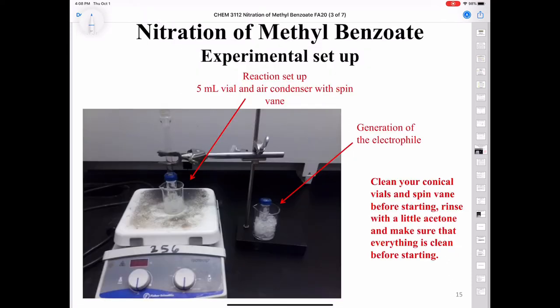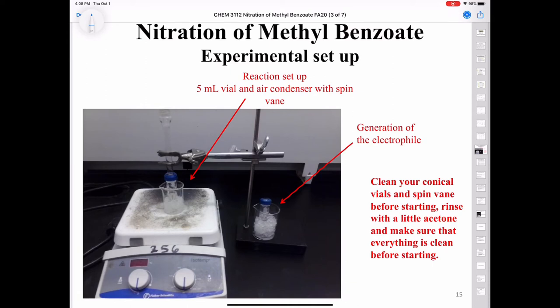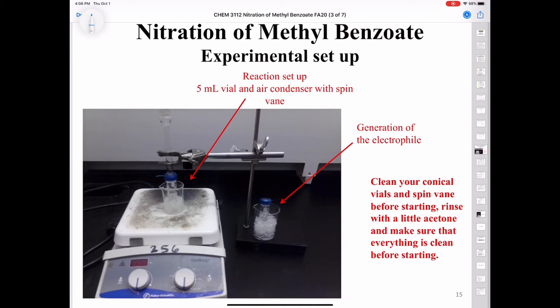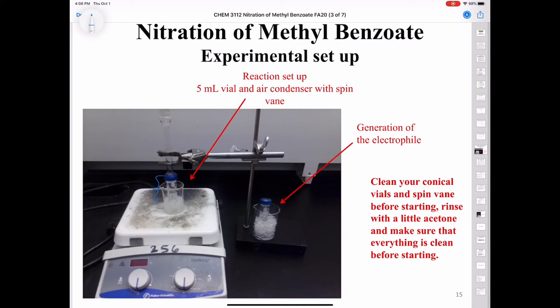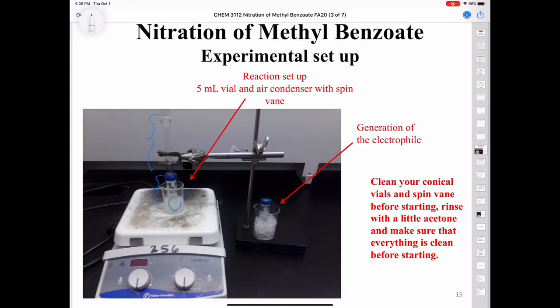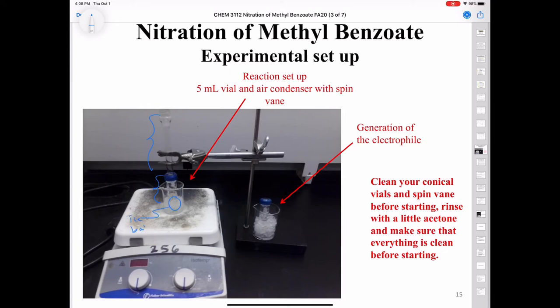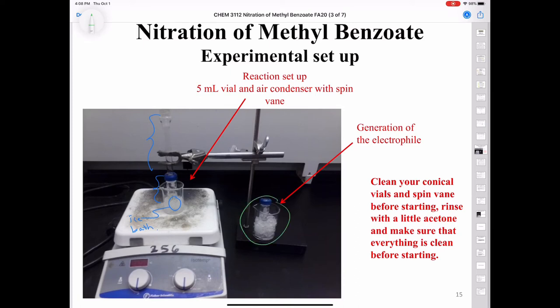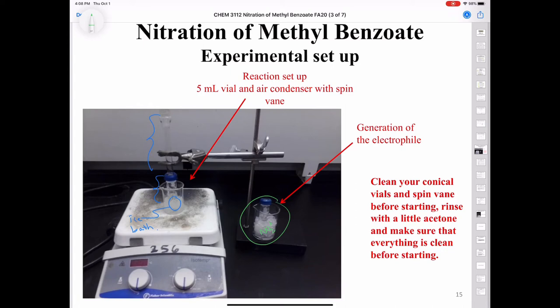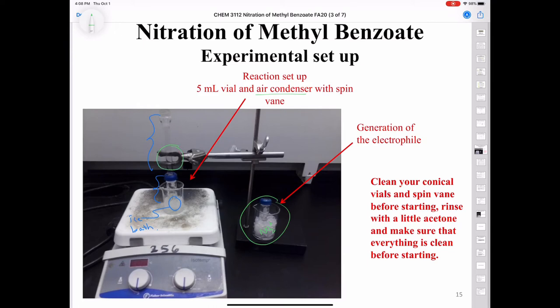This is what your experimental setup will look like. We have our 5 milliliter conical vial with our air condenser, and we have our spin vane — it's in an ice bath here. Over in this beaker, we have our nitronium ion being generated by the mixture of sulfuric acid and nitric acid. Make sure your air condenser is clamped correctly.